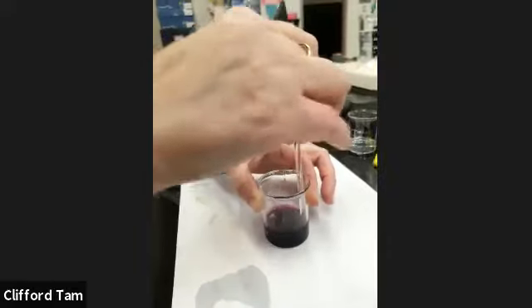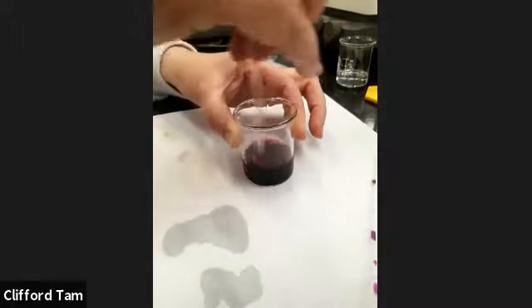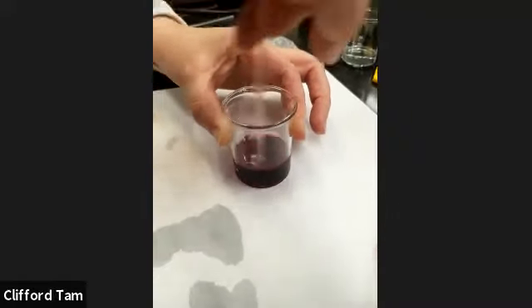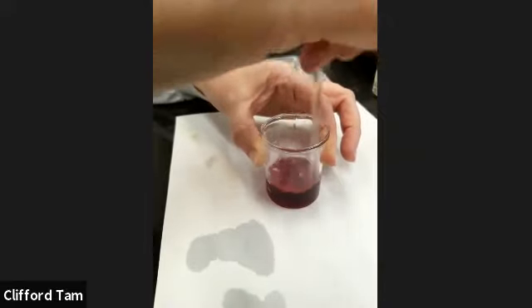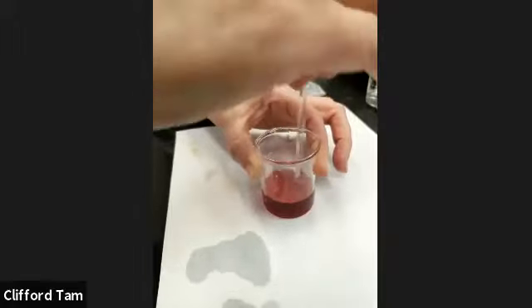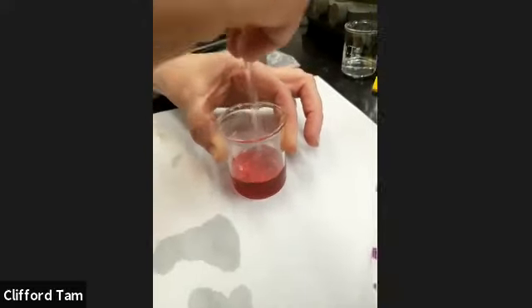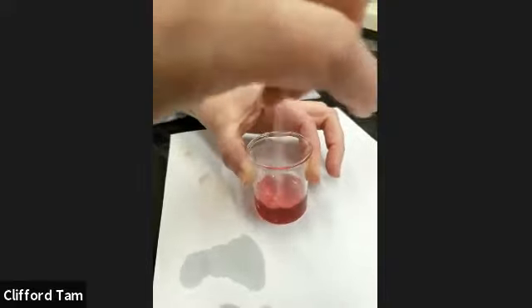Okay, here it goes. It's starting. I don't know how well you can notice, but the color is starting to change slightly. Oh, here we go. It's becoming more and more red. Over time, as she does this more and more, it's going to pretty much disappear after a while.